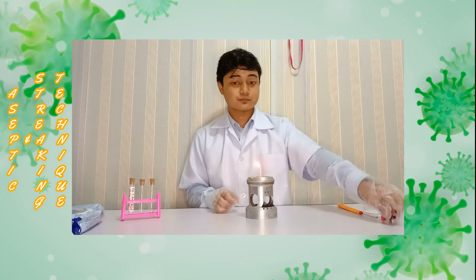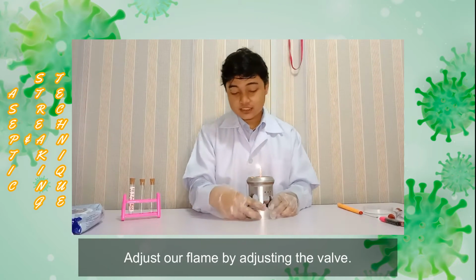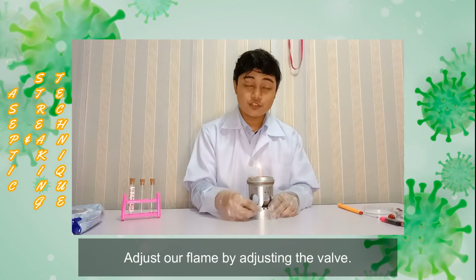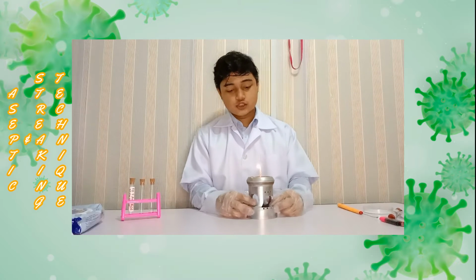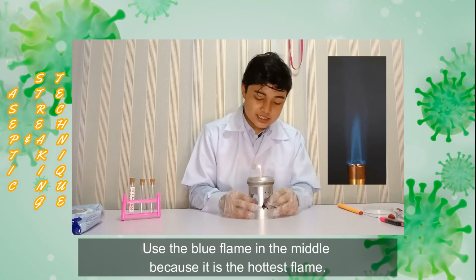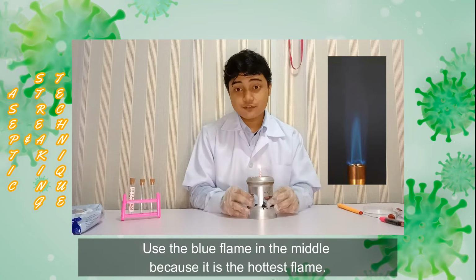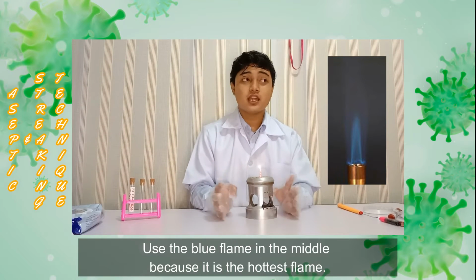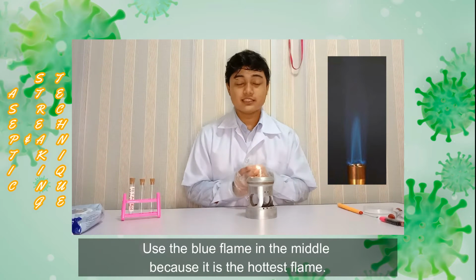Then we can adjust our flame by adjusting the valve to control the amount of oxygen that enters the Bunsen burner. We use the blue flame, especially the middle of the blue flame, which is the hottest flame in this experiment, so that the flame can kill the microorganisms during the aseptic technique.